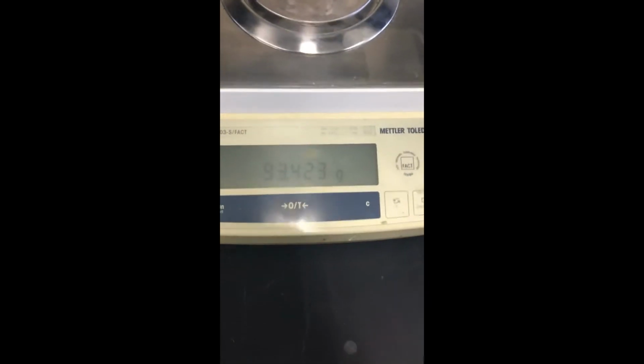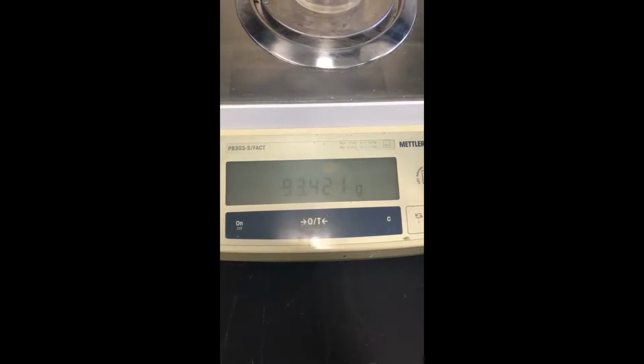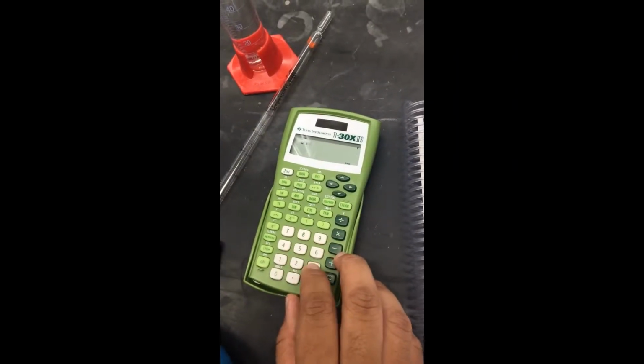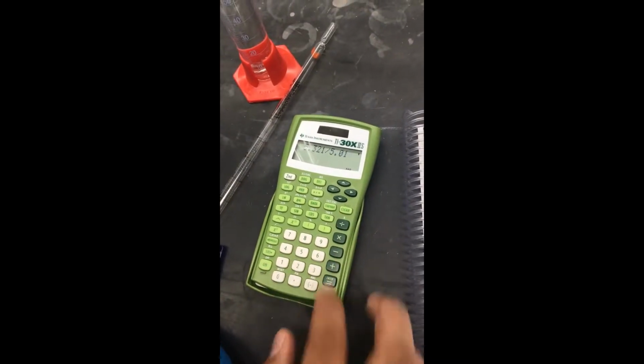Here we are measuring the mass of the 5 milliliters of stock solution. Once we subtract out the pre-weighed mass of the beaker, we get the mass of the 5 milliliters. We then take that mass, divide it by the 5 milliliter volume, and get a density of 1.06.